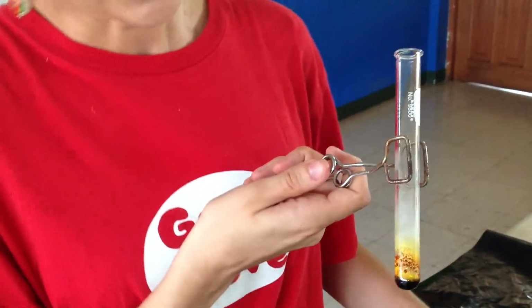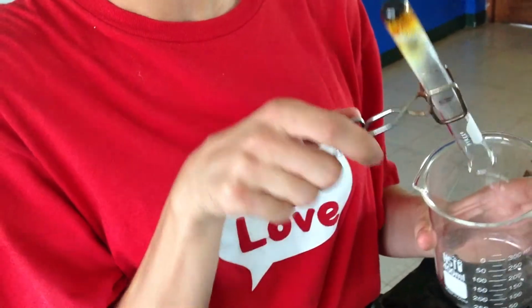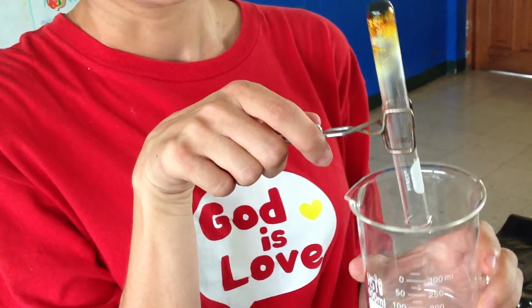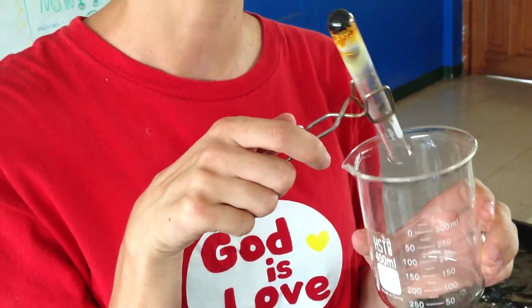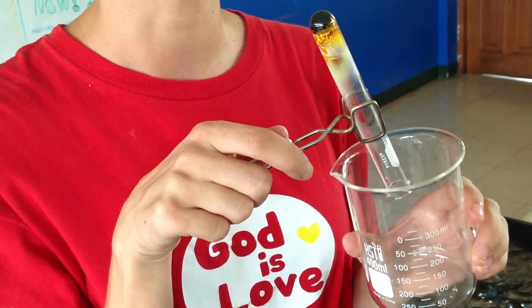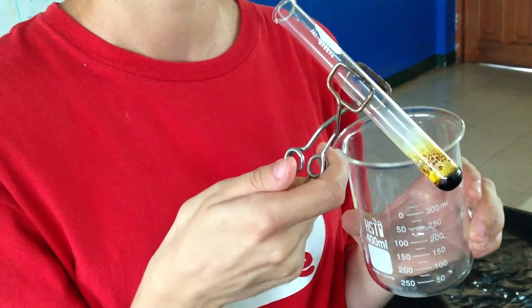And powders you would think would easily slide out of this. However, powders no longer slide out. So we've got this new concoction down there at the bottom that's just kind of stuck there. I'm actually going to have to break the test tube in order to get it out if I want it. But I don't think I want it that badly. Take a look at it that way.